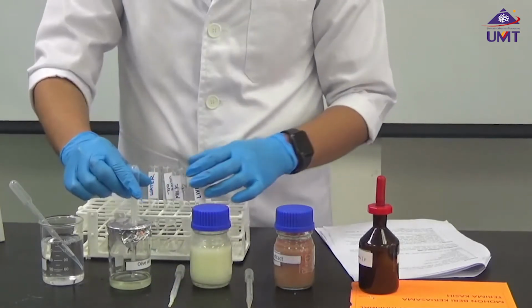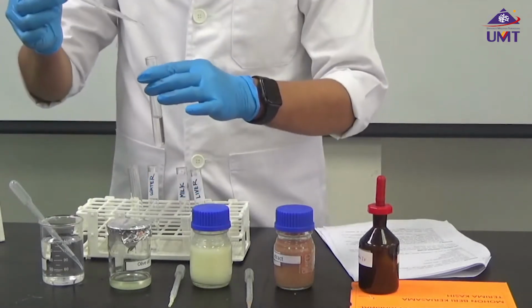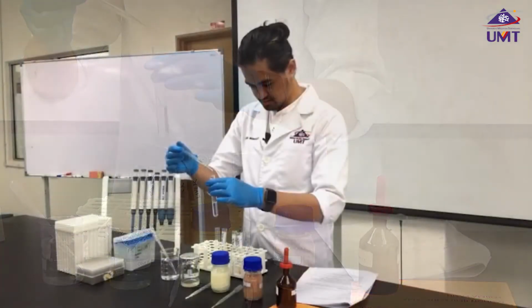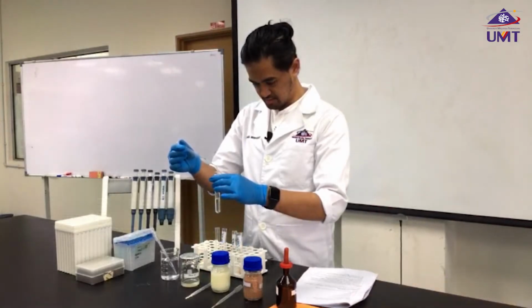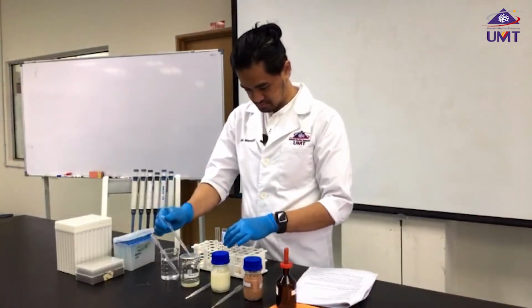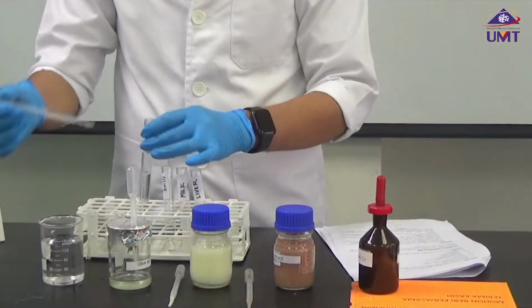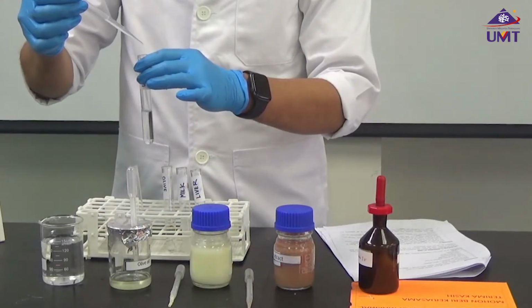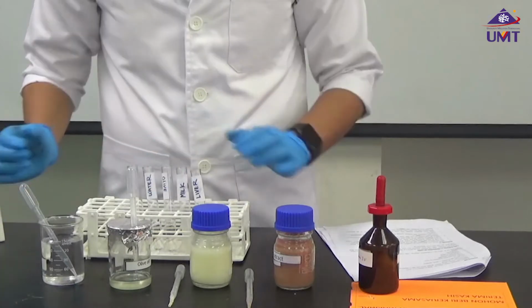Olive oil. 1, 2, 3, 4, 5, 6, 7, 8, 9, 10. And of course, just water. Okay.